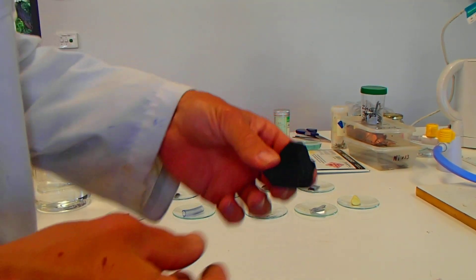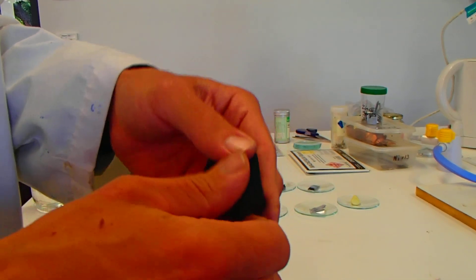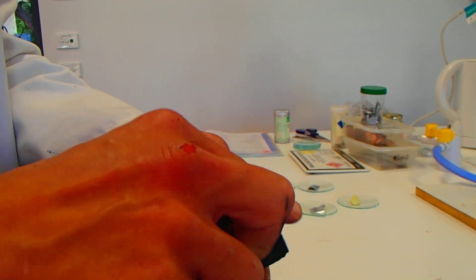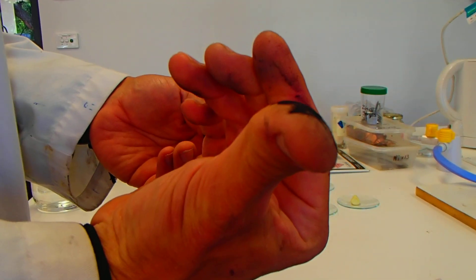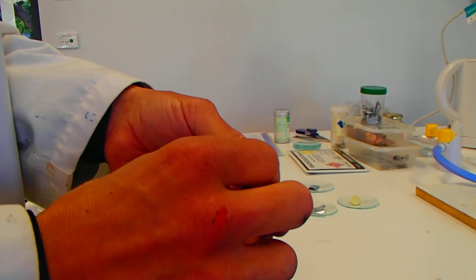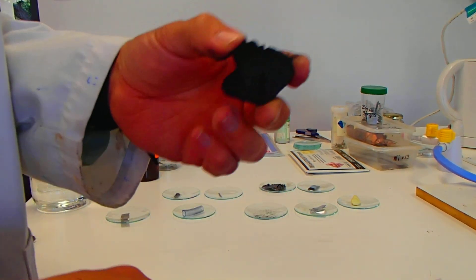And last of all, of course, we have the carbon. Let's have a look to see if it bends or... Well, it just broke in my fingers. And you can see all of the black coming off on my fingers there. So very crumbly. Easily broken. Not bendy at all. So that's carbon.